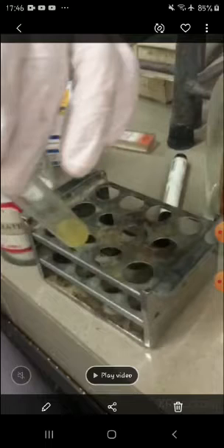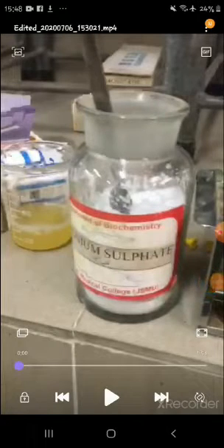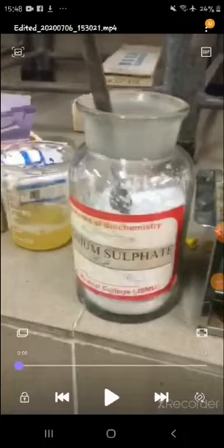The Salt Saturation Test is used to differentiate between the presence of albumin and globulin in a given sample, based on their precipitation by ammonium sulfate salt. We will perform two tests: half saturation and full saturation.